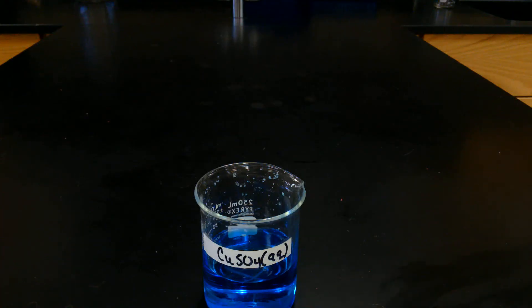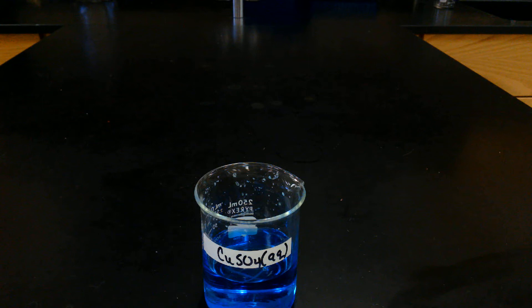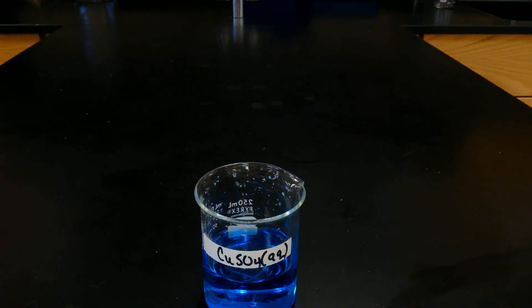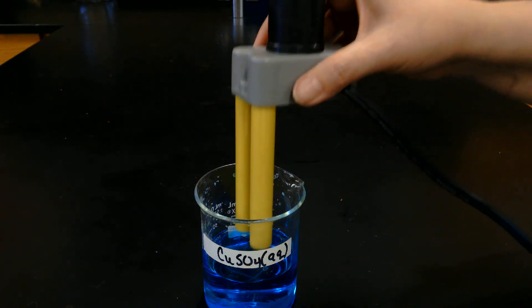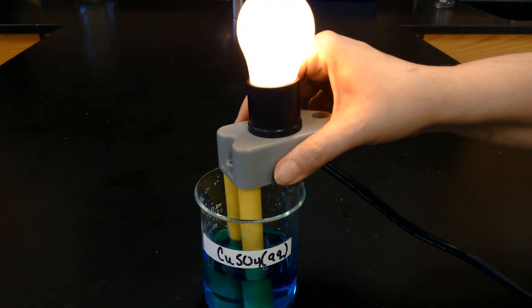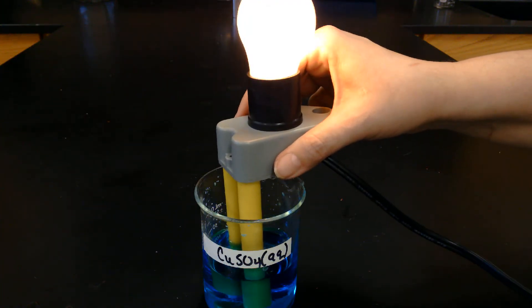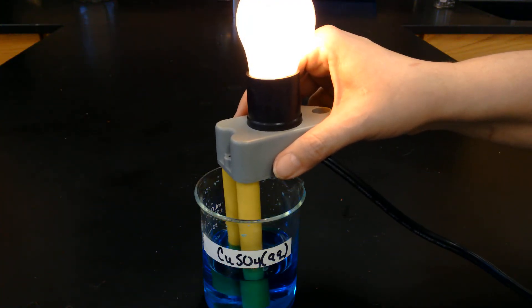Now we're going to look at pretty blue copper(II) sulfate, aqueous. See what happens when we put that in there — oh, nice and bright! Go ahead and make your observation.